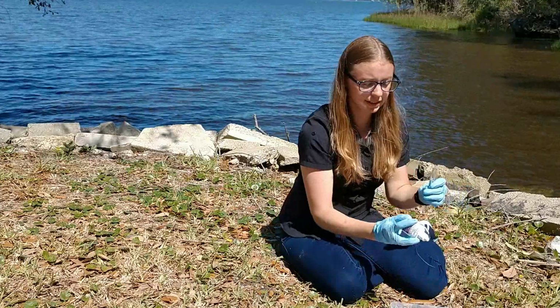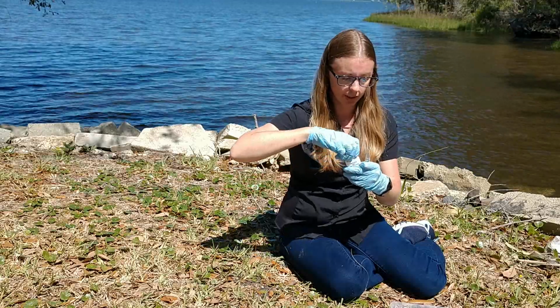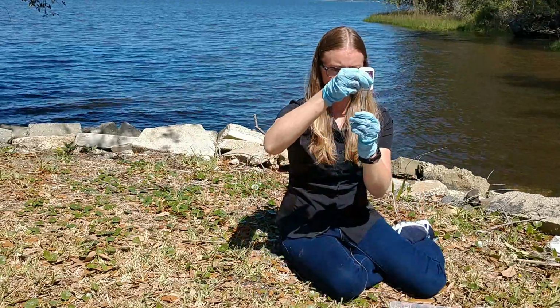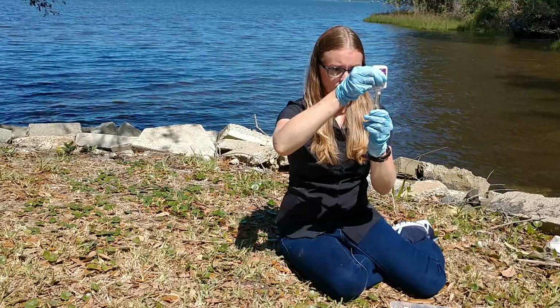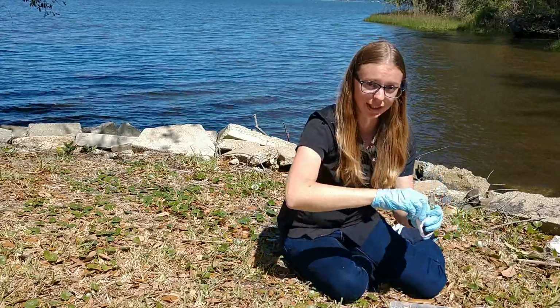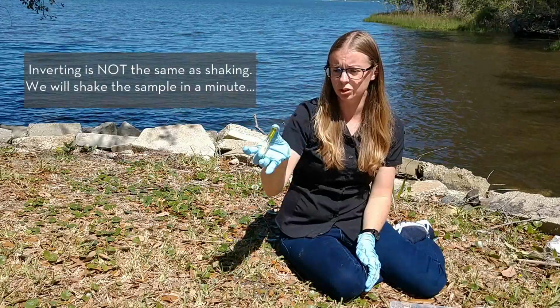I have 2 test solutions. So I have bottle number 1. I'm going to add 10 drops into my 5 milliliter water volume. I'm going to put the cap back on, and then I'm going to invert a few times just to make sure it's mixed.